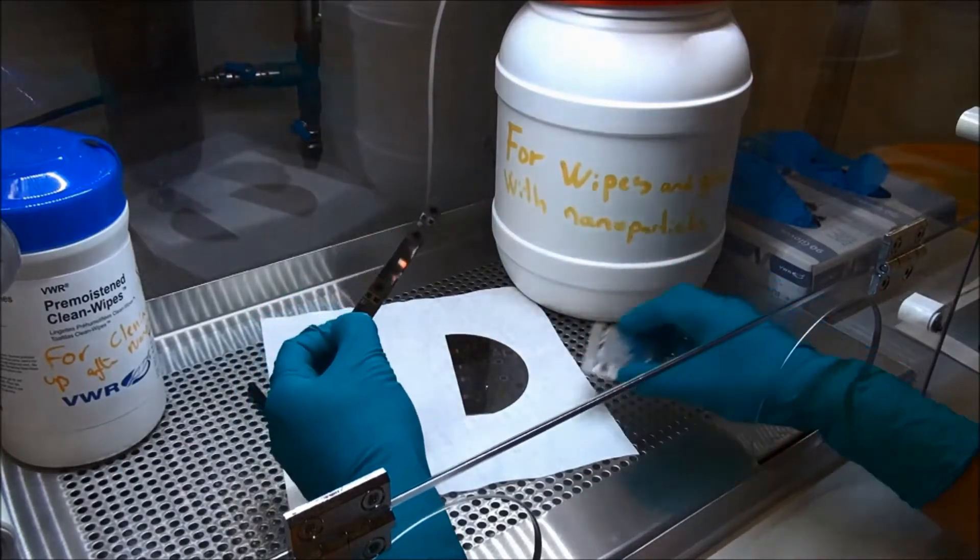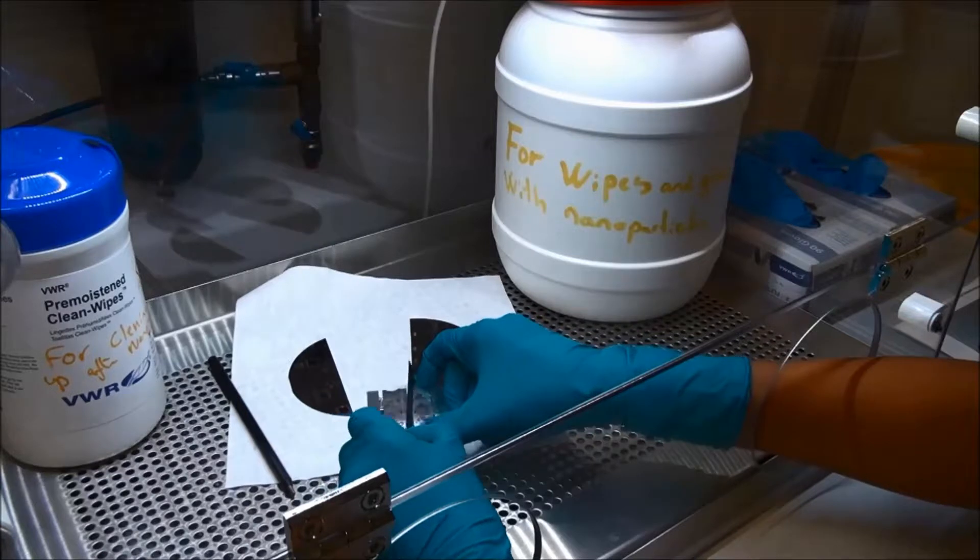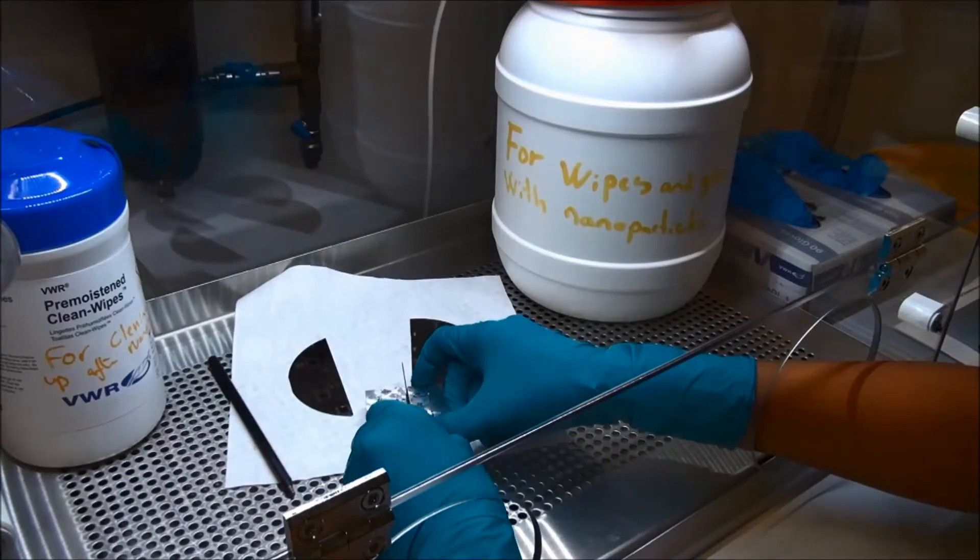So now we have the sample, which is ready to mount on the holder, like that.